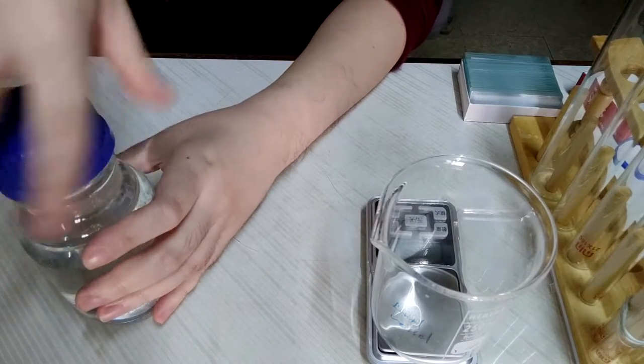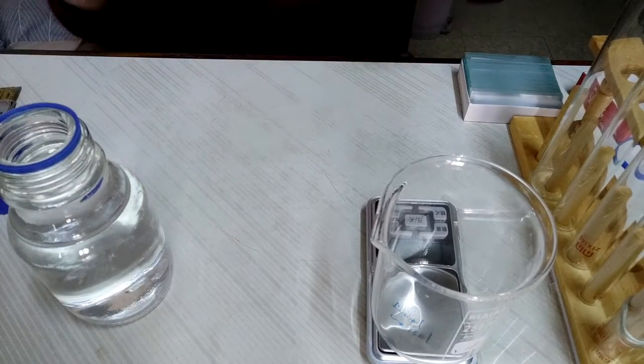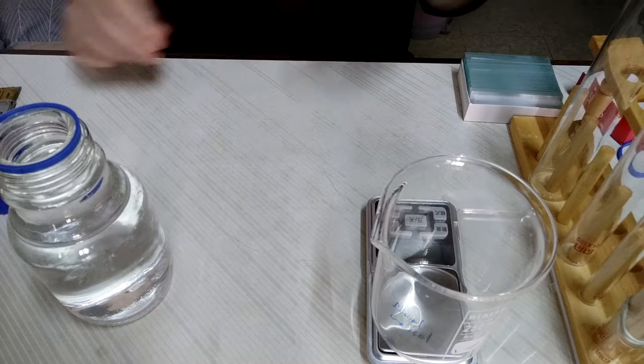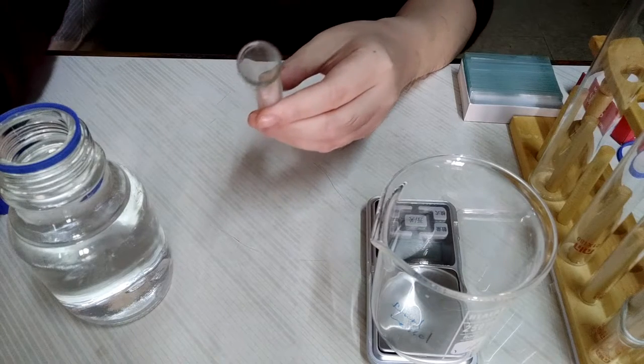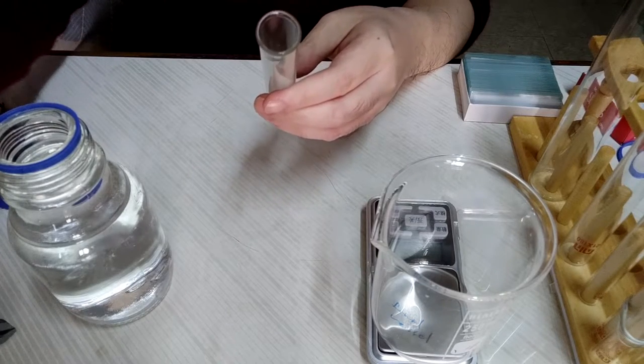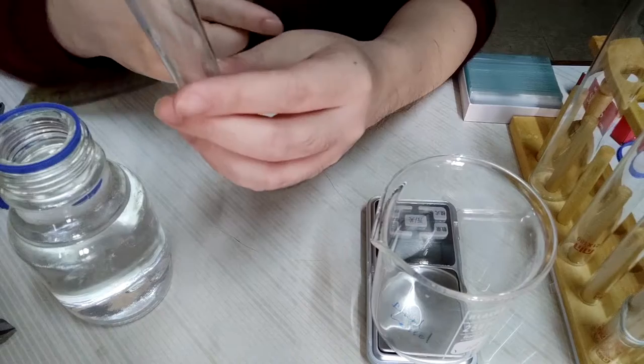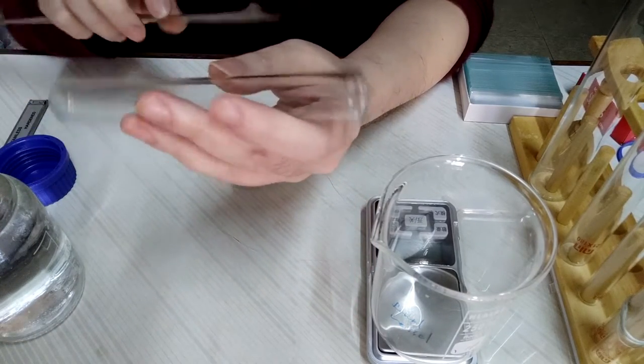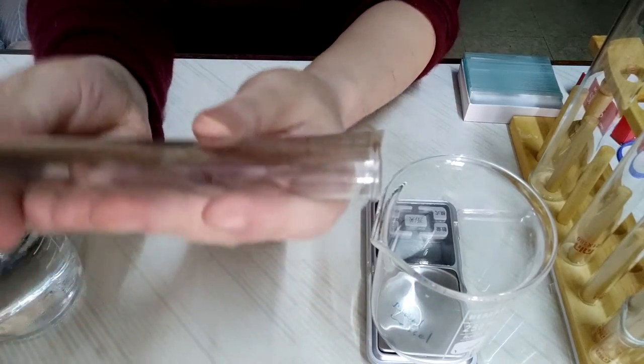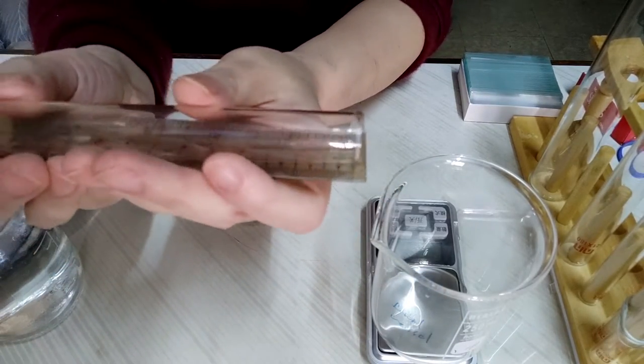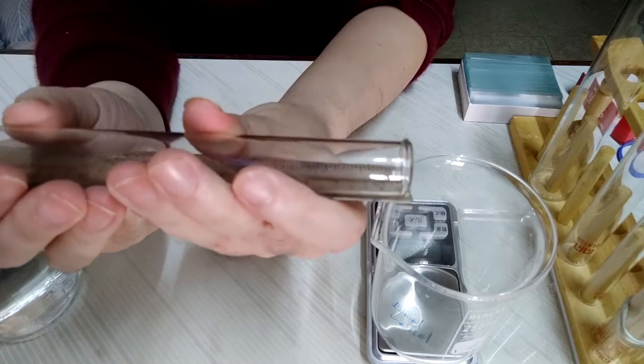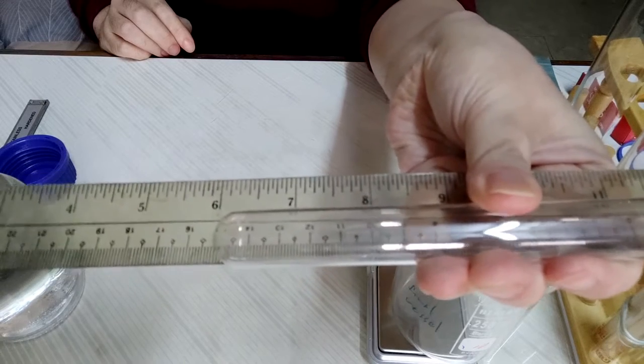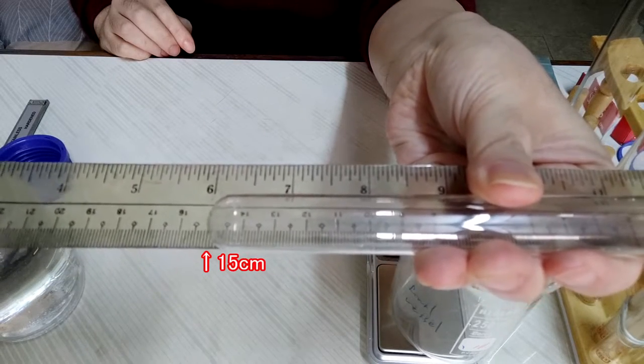So now I have a bottle of water ready here, and I am going to find the dimension of the typical test tube. Now I have a test tube which is around 15 centimeters in length.